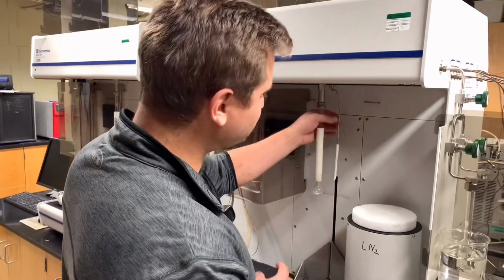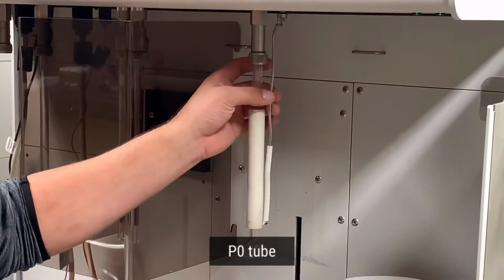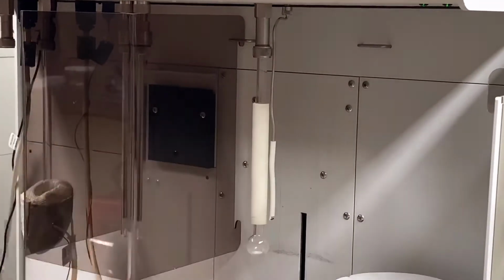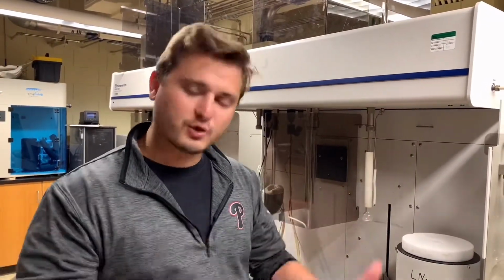The next thing we want to do is take this tube, which is called the P0 tube. This is a reference pressure tube that is used for comparing the pressure in the tube sometimes to the pressure that is in the sample tube. That allows us to get different information that the instrument uses to calculate pore sizes, pore volumes, BET surface areas, Langmuir surface areas, and other things like that.